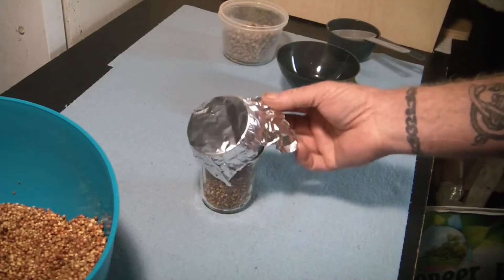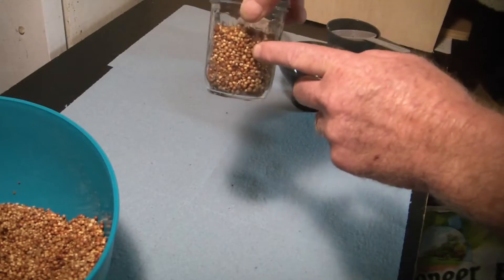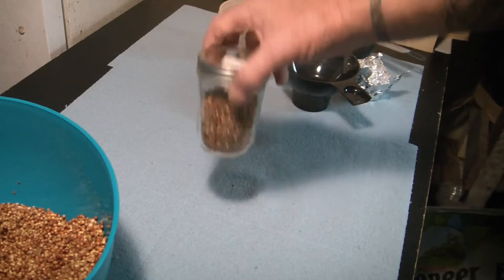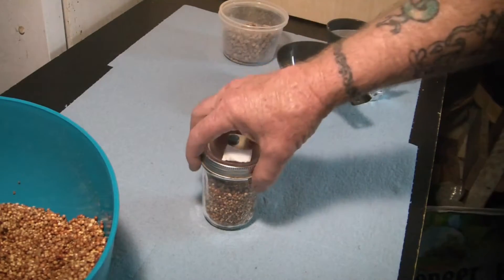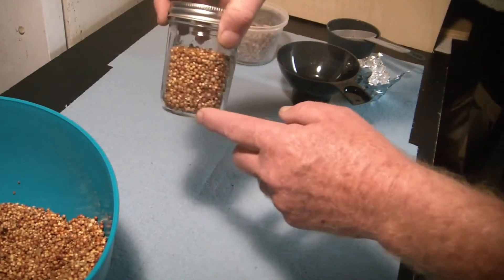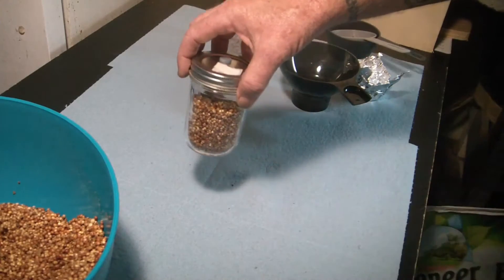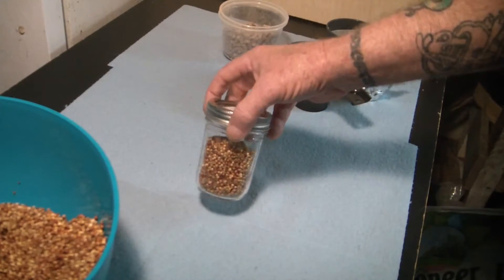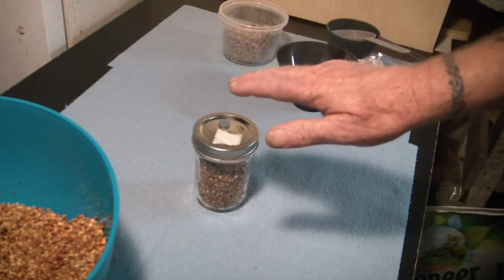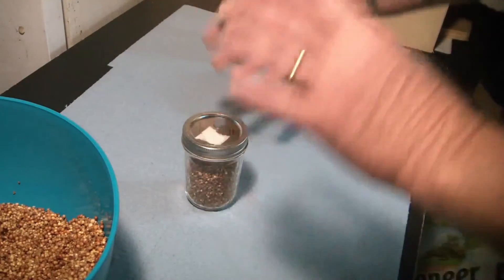These things are great — and you might think this is more of a waste than an agar plate, but that's not true. This is a perfect amount to use for a grain-to-grain transfer to a full-size jar. You can do a couple of these to test something, and if they come out clean with no signs of bacteria, you can break this jar up, make up some jars that are a little bit underfilled — fill them no more than about two-thirds full — and that extra half cup gives you about three-quarters. Just do that mix.